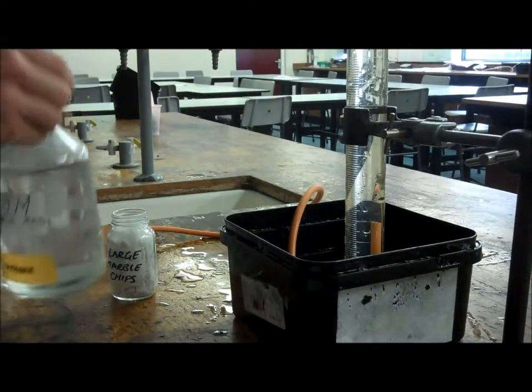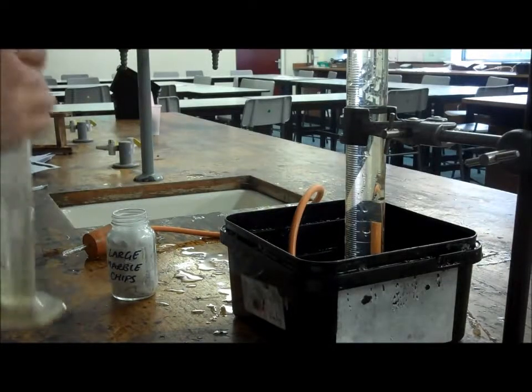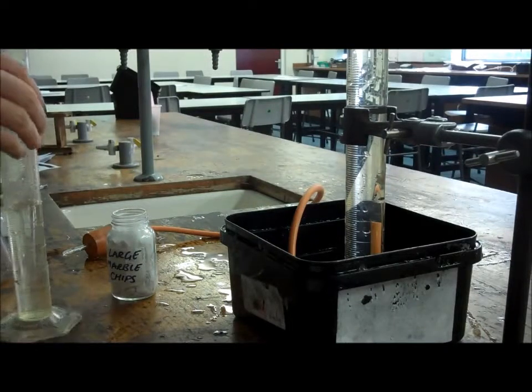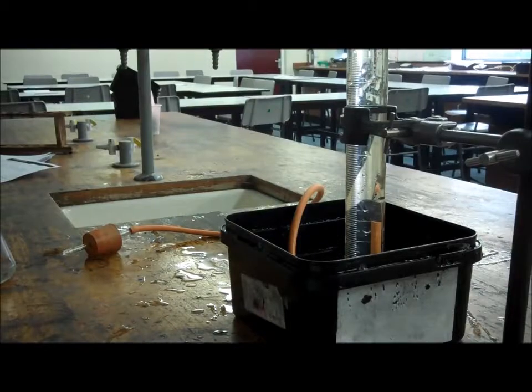The second one I'm going to do is from the fridge. So the same technique, measure out 50 ml. You always have to measure the temperature, not just taking the temperature of the fridge, because it will change between taking it out of the fridge and placing it into the conical flask. So straight away, thermometer in, leave it there for 30 seconds and measure the temperature. The temperature for this one is 8 degrees.